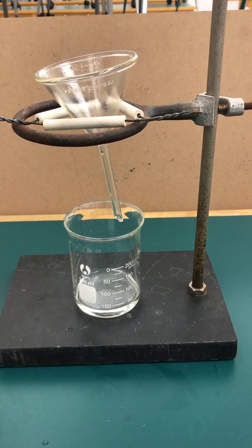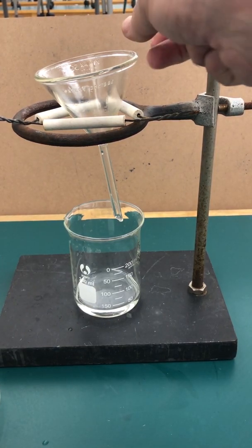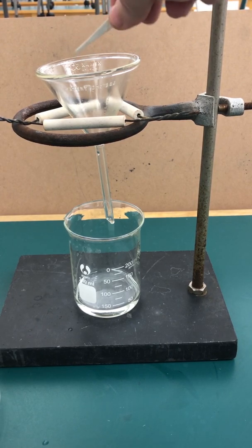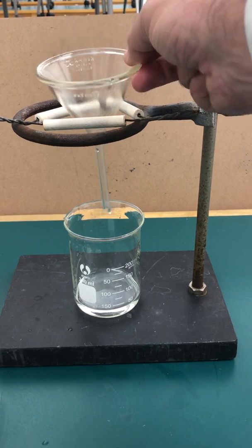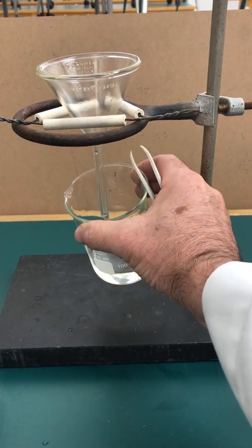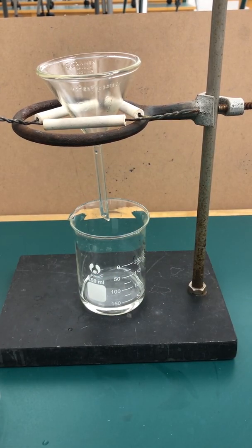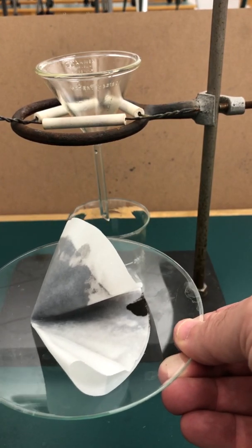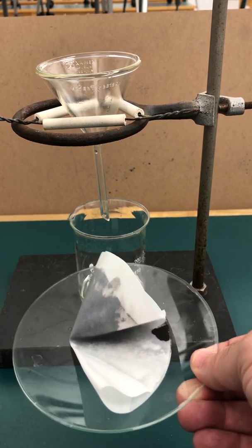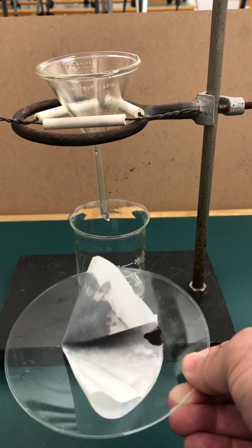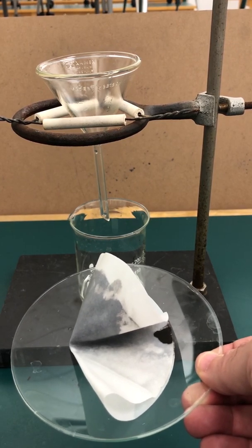One of the things you want to check for before you leave is sometimes when we do the rinse, perhaps you were a little too eager, too enthusiastic about the water, and you might have accidentally caused some of your stuff to splash between the filter paper and the glass funnels. You want to inspect to make sure your glass funnel is clean, that that didn't happen. Also, your filtrate should be very clean. There should be no black or blue stuff in it. If there is, if you had some blue stuff, it means you did not have a complete reaction. If you have black stuff, it means that your filtration leaked somehow. So be aware of those kinds of things as possible sources of error. We are now going to take our watch glass, take a piece of tape and put your name on it. We're going to bring it to the oven to let it dry overnight. Then the next lab session, we will come back and re-weigh the filter paper now with the copper 2 oxide product in it. And the difference of that will let us know how much copper 2 oxide we obtained.